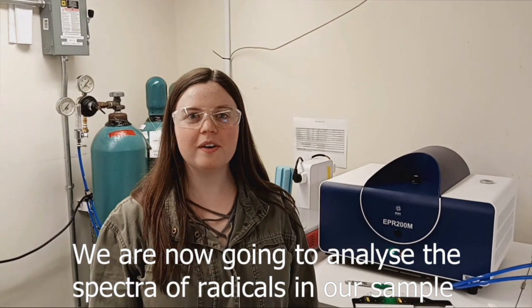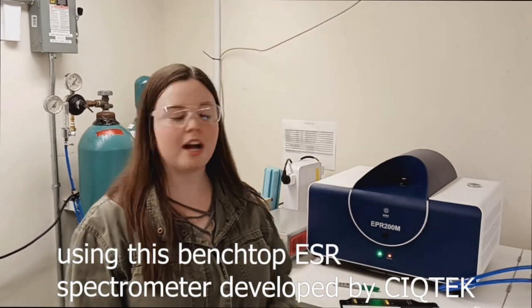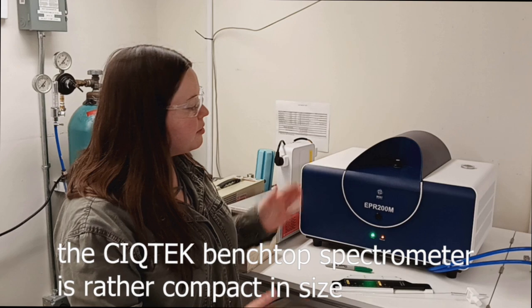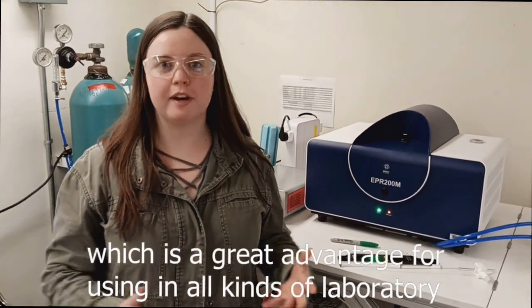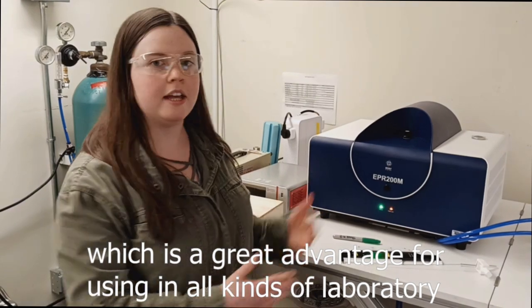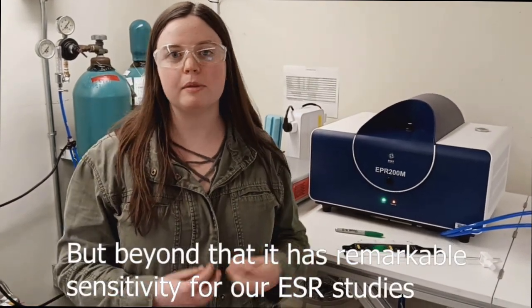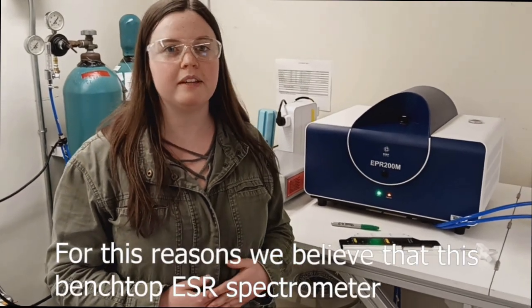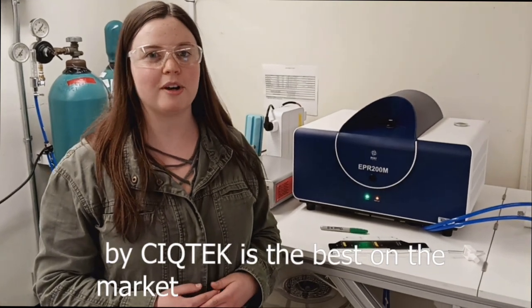We are now going to analyze the spectra of radicals in our sample using this benchtop ESR spectrometer developed by CIQTEK. This CIQTEK benchtop spectrometer is rather compact in size, which is a great advantage for using it in all kinds of laboratory space. But beyond that, it has remarkable sensitivity for our ESR studies. For these reasons, we believe that this benchtop ESR spectrometer by CIQTEK is the best on the market.